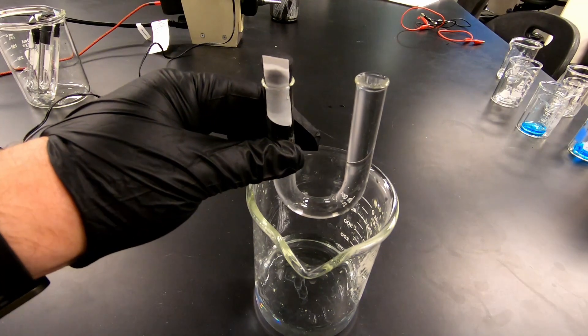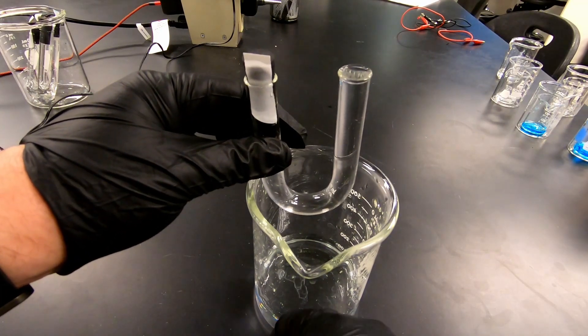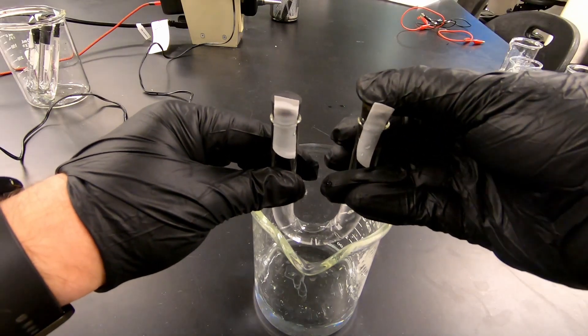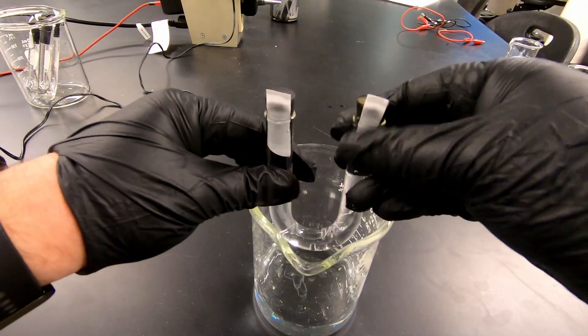And we'll just do the exact same thing on this other side. If you have a little overflow, that's fine. That's why we were doing it over the waste container.